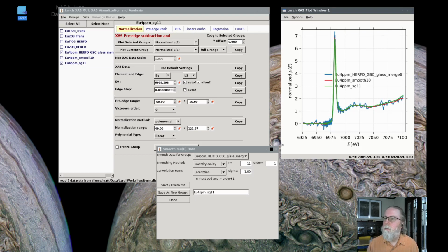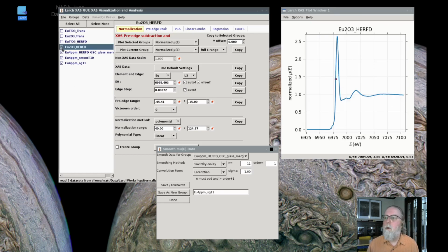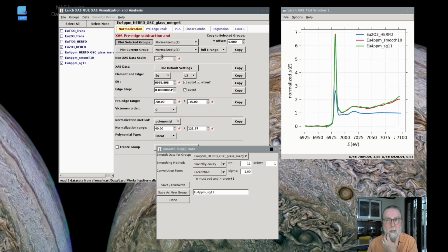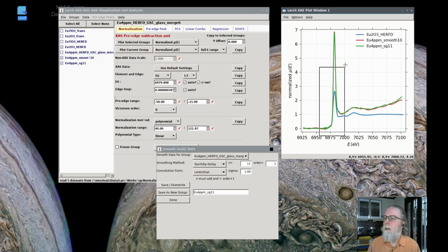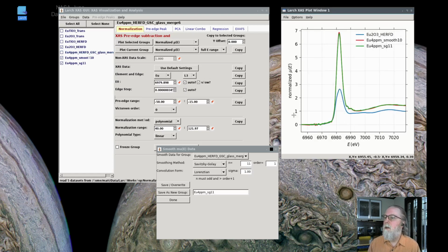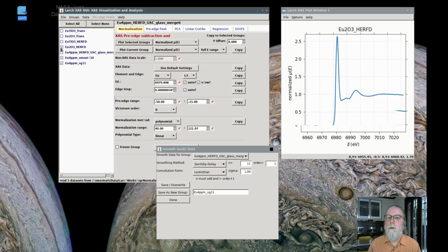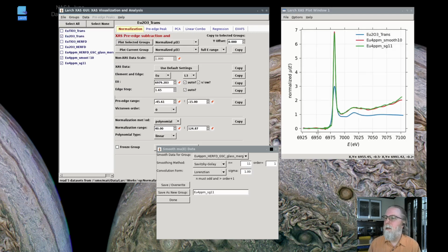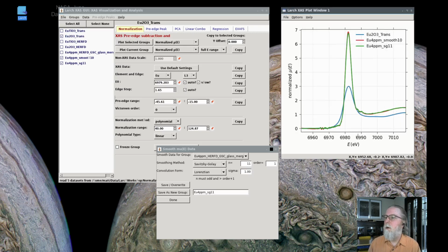But as we smooth that data, did it make it appear to be more like the europium oxide data? That is really the question we would want to answer. And the answer is, it appears to still have a much stronger white line. This europium data was measured in HERFD, so that's fluorescence, and on a standard, so there is the potential for being self-absorbed, but that's the data for transmission. So that data you would consider to be correct transmission data.